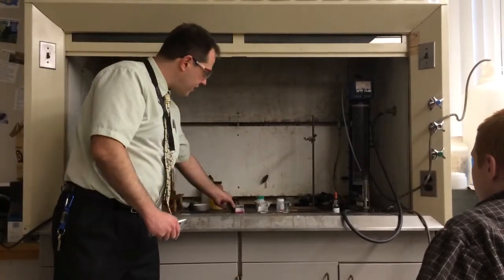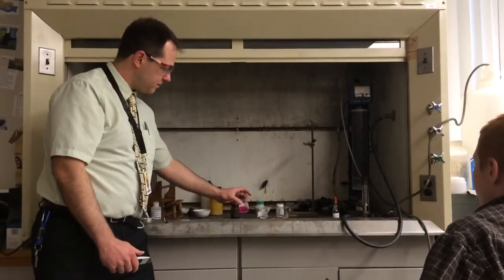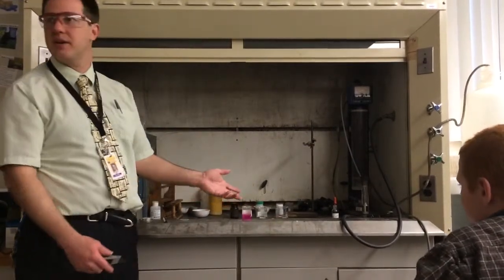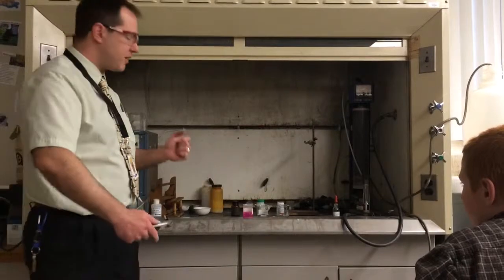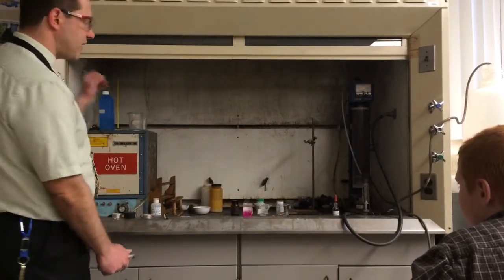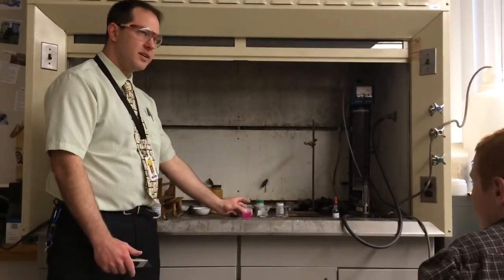So what can you say about one of the products of this reaction? Pink? Right, because it's pink, what does that mean? It's a base. One of the products is a base, one of the products is actually lithium hydroxide, which is a base.